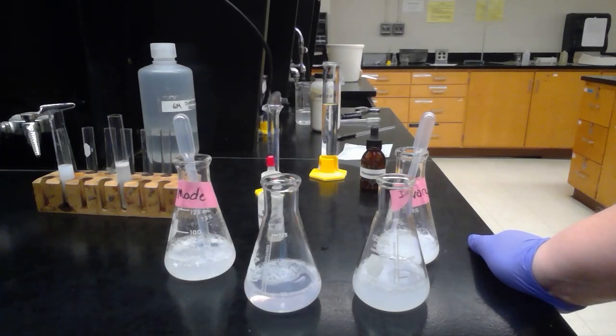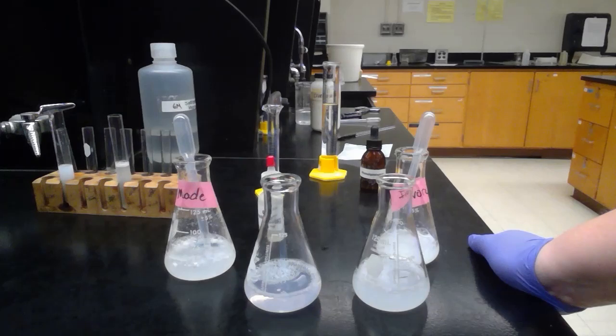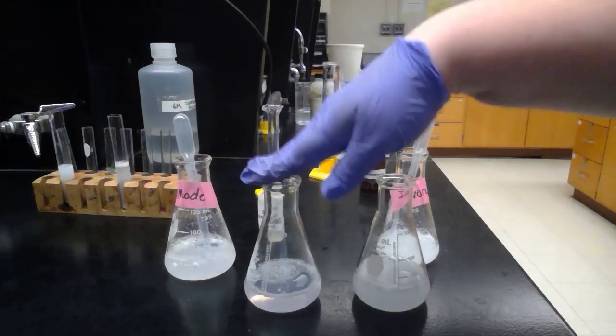Remember there's a conversion in your notebook that says that for every 20 drops that's equal to one milliliter. So you want to convert the number of drops we used into milliliters and record that for your hydrochloric acid, how much of that was needed to neutralize our sample soap solution.